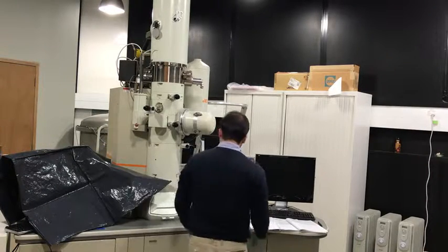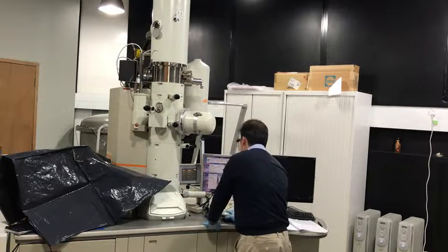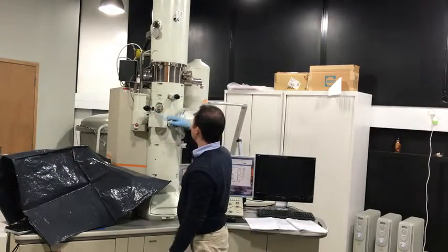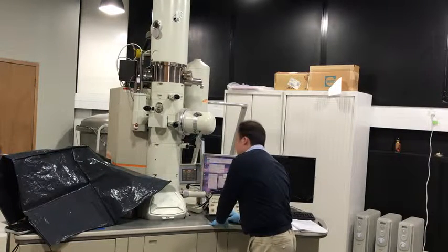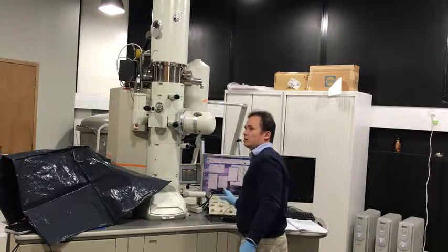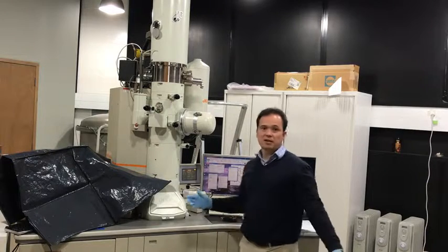And then we finish off by going to the maintenance panel, ACD and bake, and anti-contamination device heater on. Sends out a warning, please check the apertures are out, because you don't want gunk all over the apertures. They are all out. Helps to double check everything. Okay, and then you'll hear a sound of all the valves closing. And that's it. That's the end of the session.